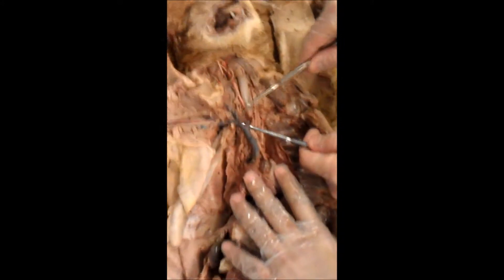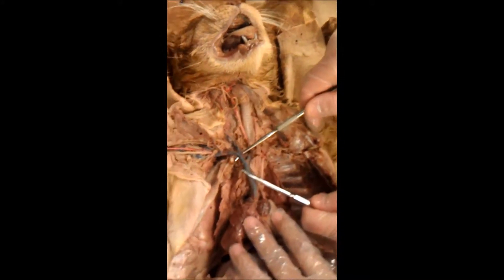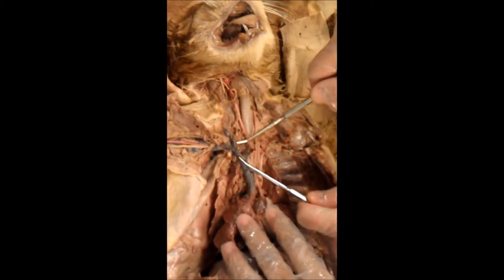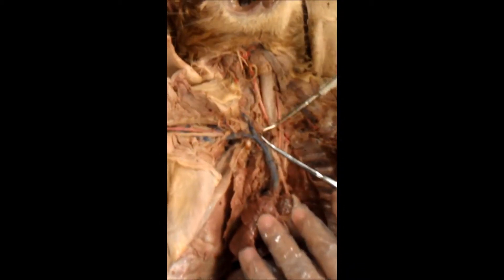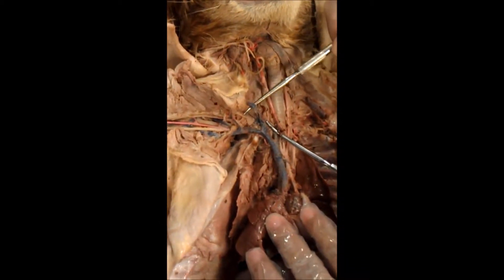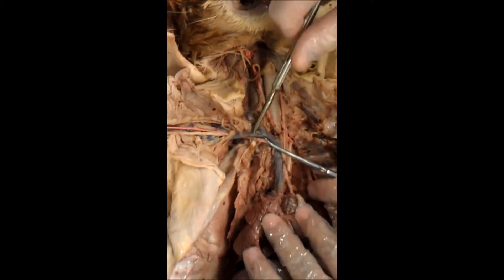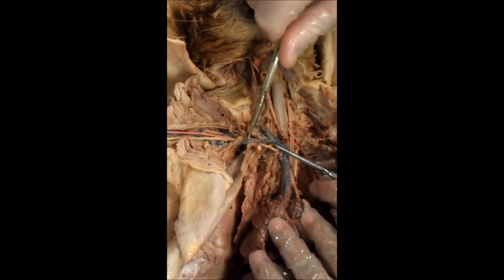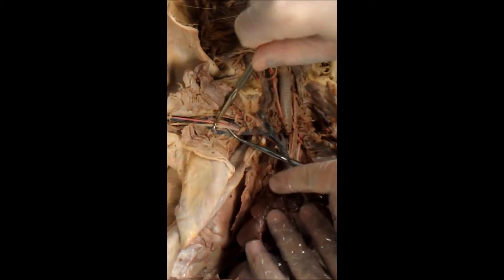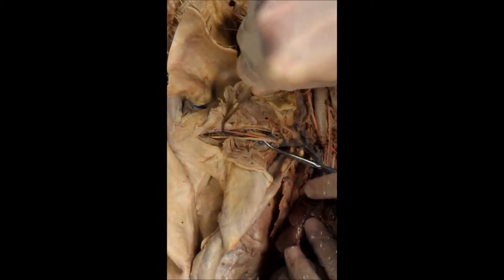This nub right here is a brachiocephalic vein. This is a brachiocephalic vein. Coming off of the brachiocephalic, we have the external jugular. Moving more lateral, we have the axillary vein. Moving even more lateral, you have the brachial vein.